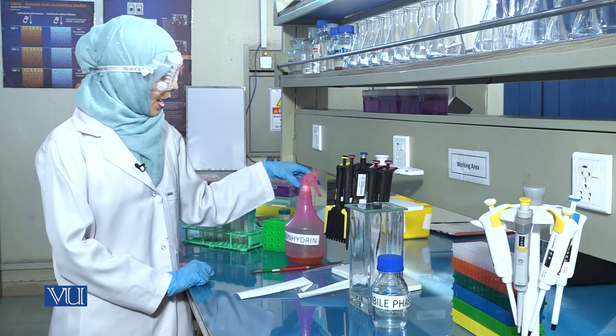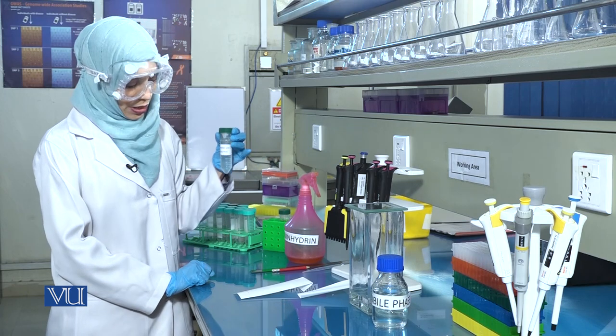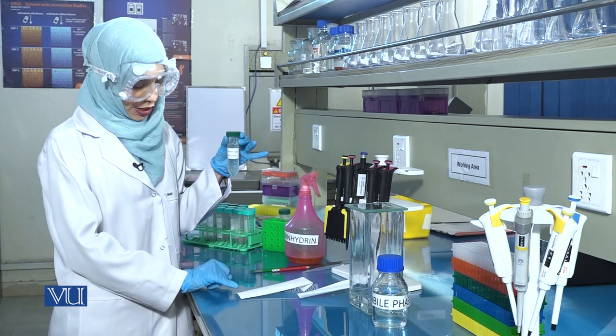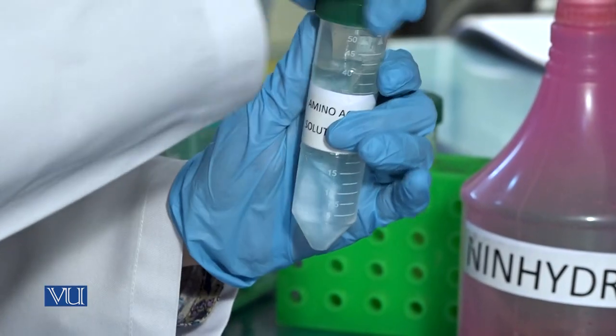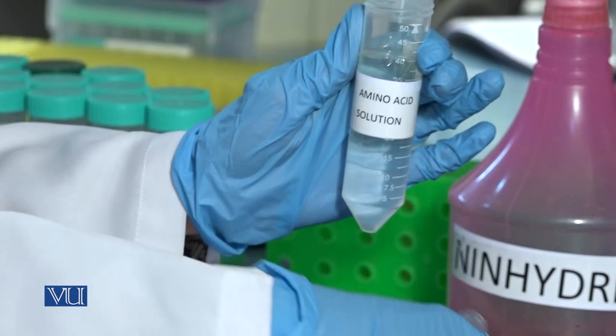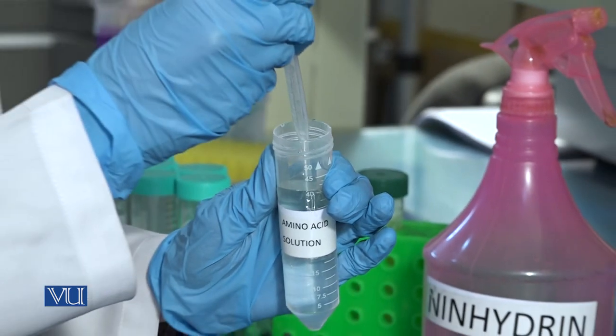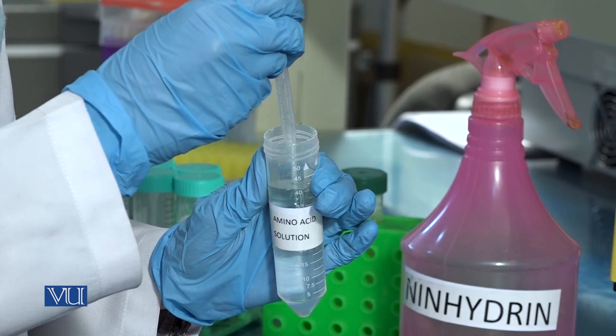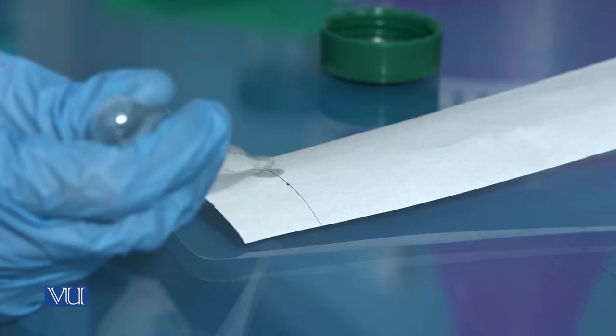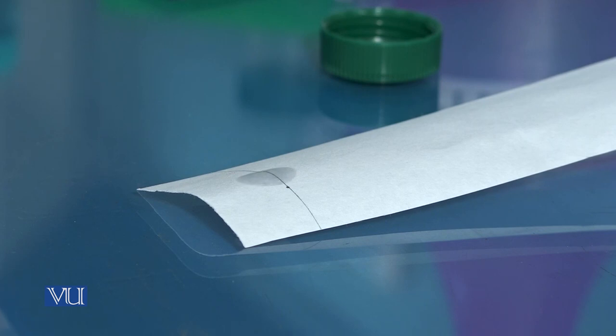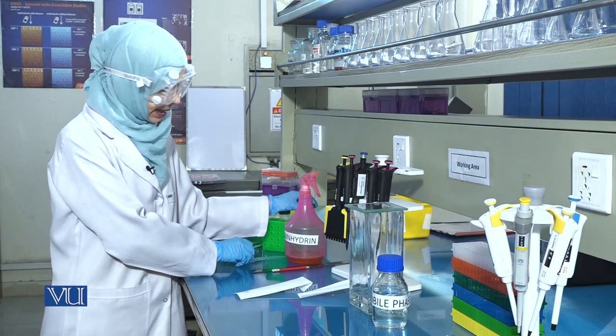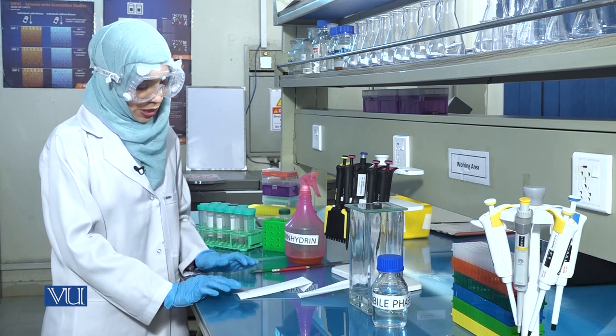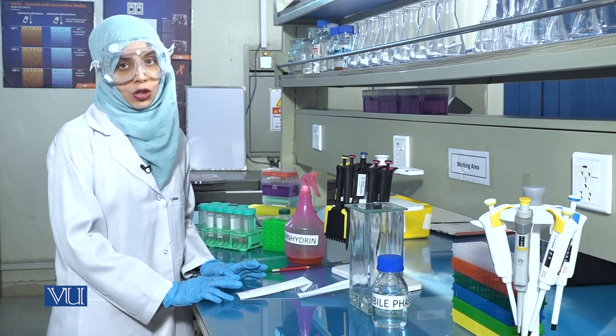In the next step, carefully place a drop of the amino acid solution on the filter paper. If more than one sample has to be analyzed, the distance between the spots of the two samples should be at least 2 cm.